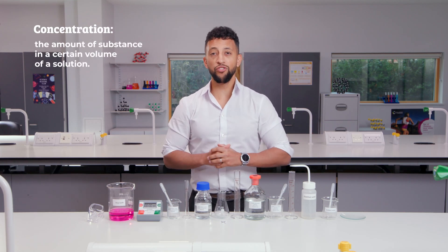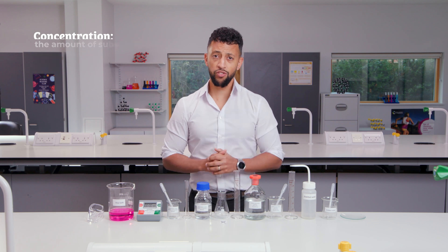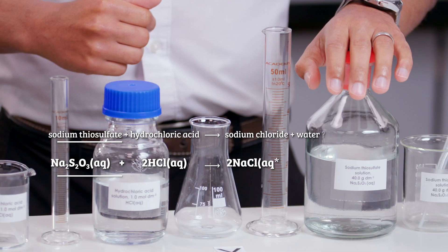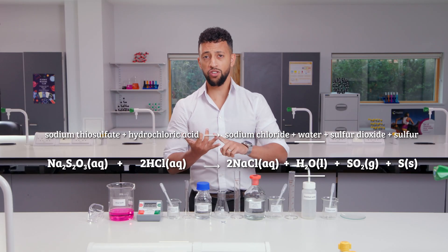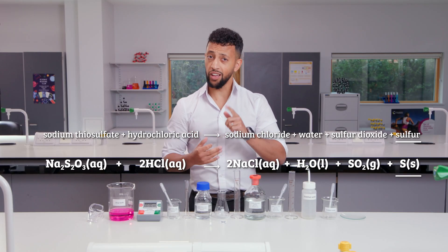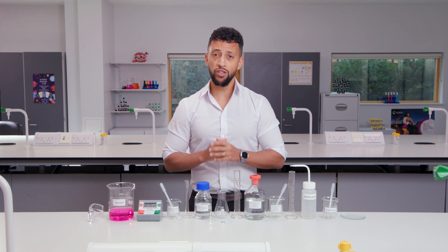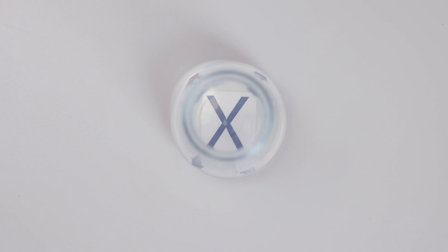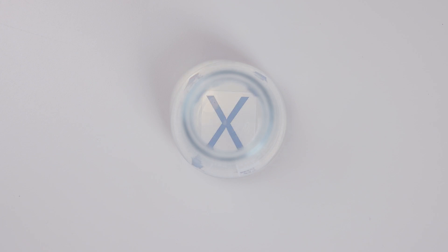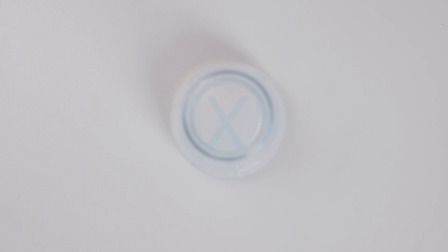In this experiment we'll investigate how concentration affects the rate of reaction. To do this, I'm going to react sodium thiosulfate with hydrochloric acid to produce sodium chloride, water, sulfur dioxide gas, and sulfur. The sulfur produced forms a yellow-white precipitate which makes the liquid cloudy. We can time how long it takes to reach a certain level of cloudiness by timing how long it takes not to be able to see a black cross through it.